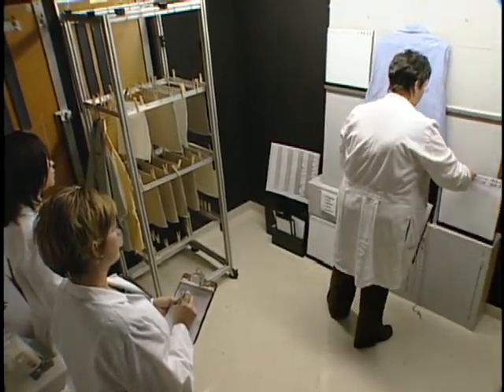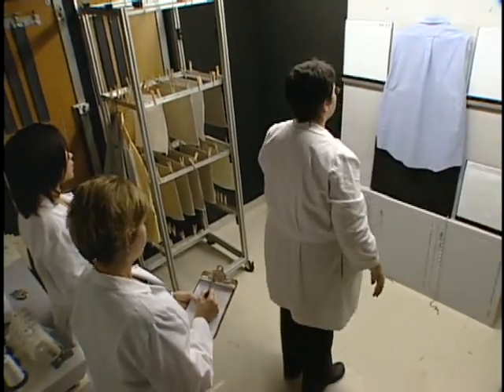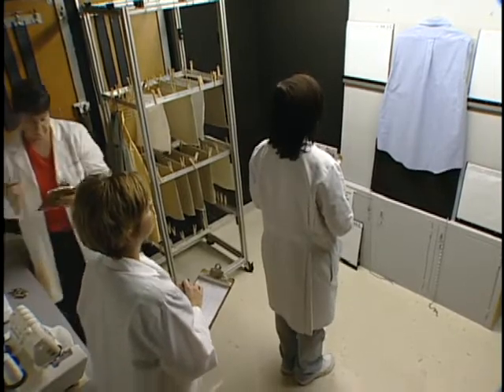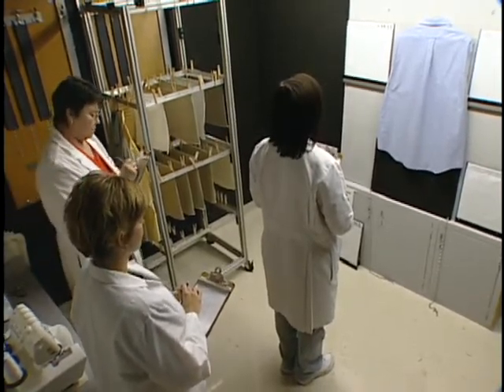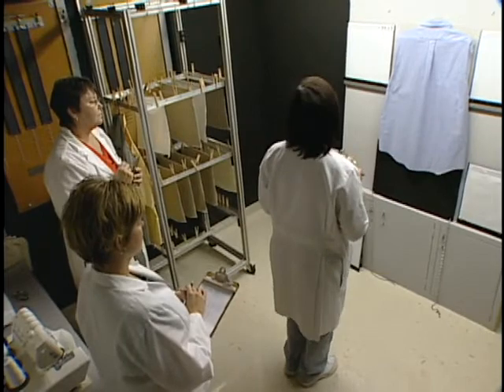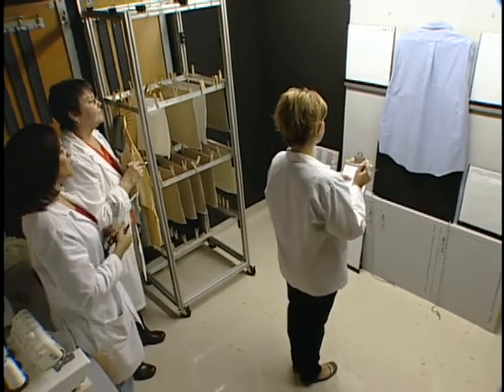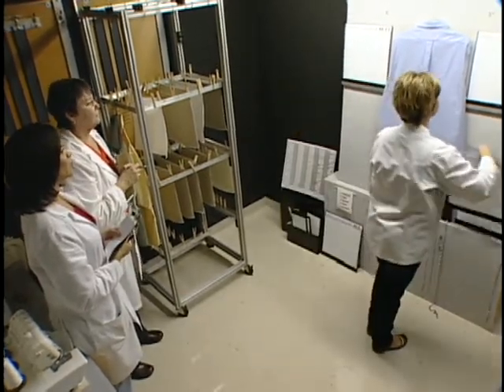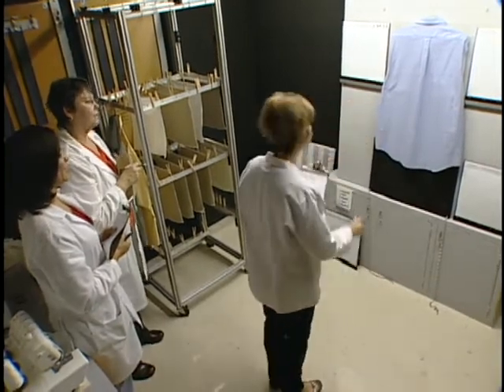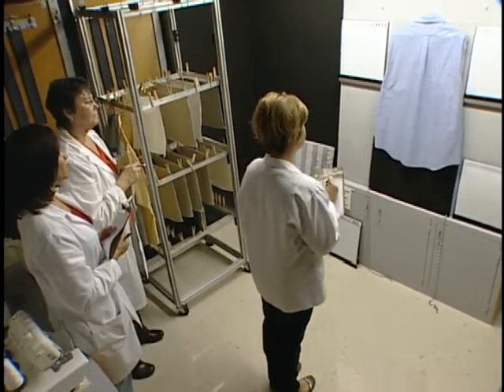The same standard replicas used in AATCC Test Method 124 are used for this evaluation. For smoothness appearance of a garment, mount the specimen on the viewing board with the garment length in the vertical direction and place the most similar three-dimensional plastic replicas on each side. In this example, a long-sleeved dress shirt is placed on the viewing board with the back of the shirt out. The sleeves are placed between the front of the shirt and the board to expose the largest area possible on the back. The rater then determines a numerical grade of smoothness from the replica that most nearly matches the smoothness appearance of the test specimen. Note that prints and patterns may mask the mussiness present in the textile product.